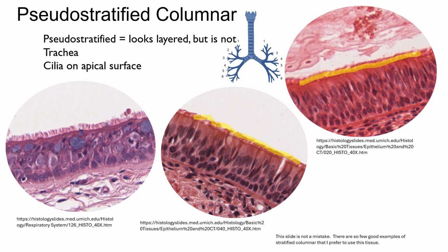So these cilia, they're kind of like a mucousy shag carpet that waves in the wind. And so to make the name of this tissue even more complicated, its name is pseudostratified ciliated columnar epithelia with mucus cells scattered between it. I just want to highlight some of them over here on the left.